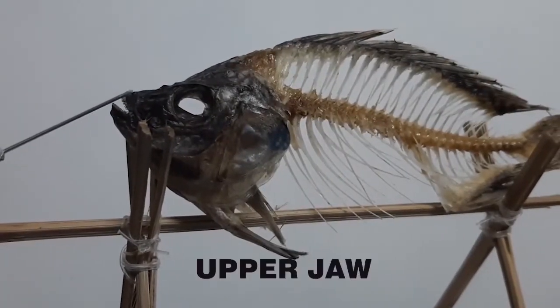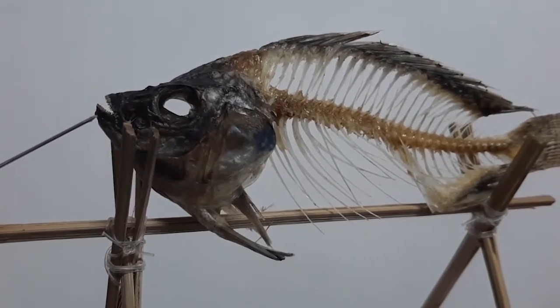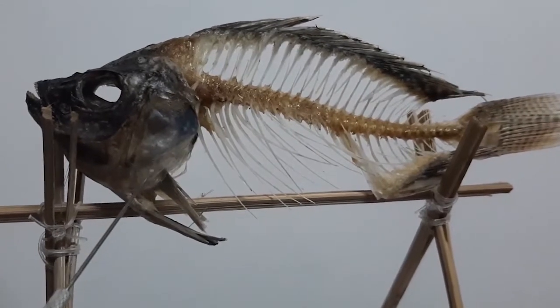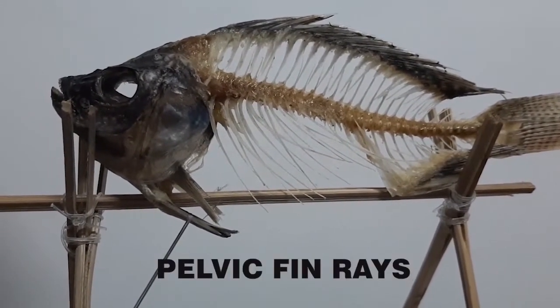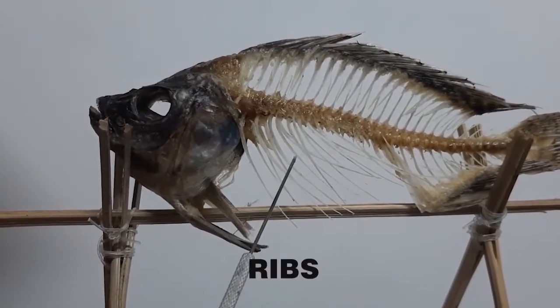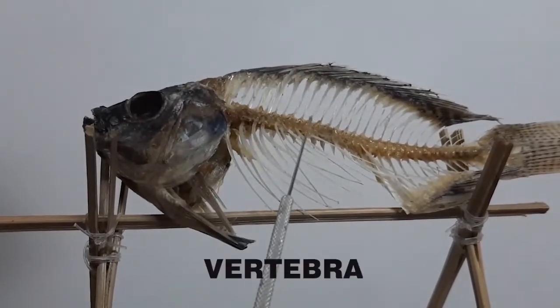This is the upper jaw, lower jaw, orbit, operculum, pelvic fin rays, pectoral fin rays. These are the ribs, vertebra.